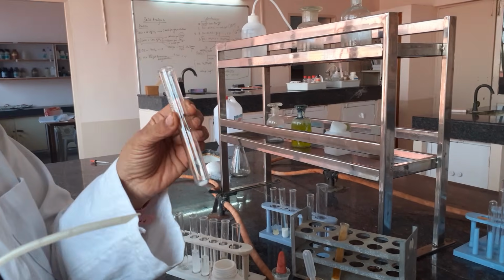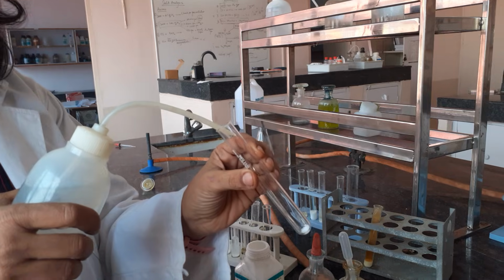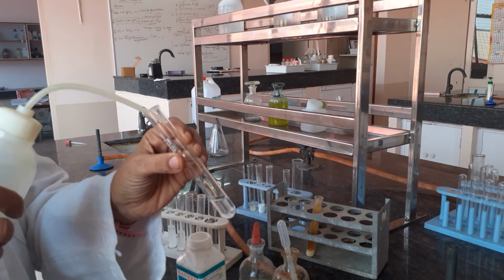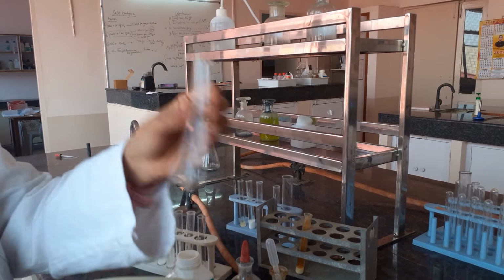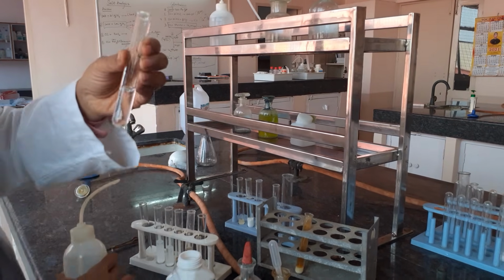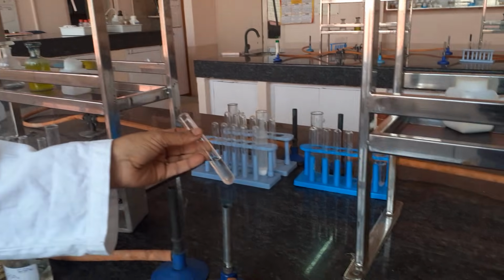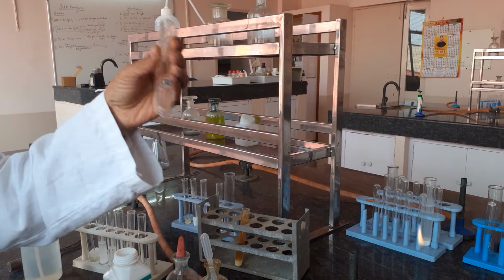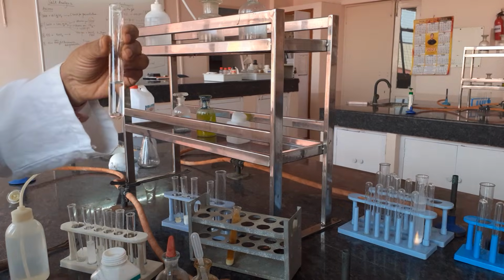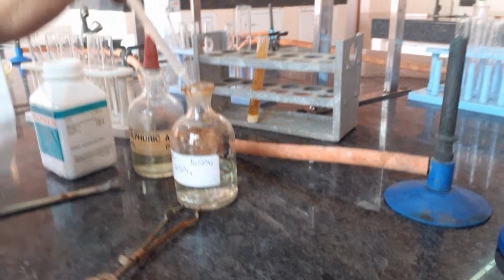Otherwise your OS will not be clear. So you will be adding distilled water to the salt and you will shake it to dissolve. Do not proceed till the salt gets dissolved. You can slightly heat it if you want, just to dissolve the salt, since it is very cold these days. Once your salt is dissolved, you will add one to two ml of freshly prepared ferrous sulfate solution to your test tube.